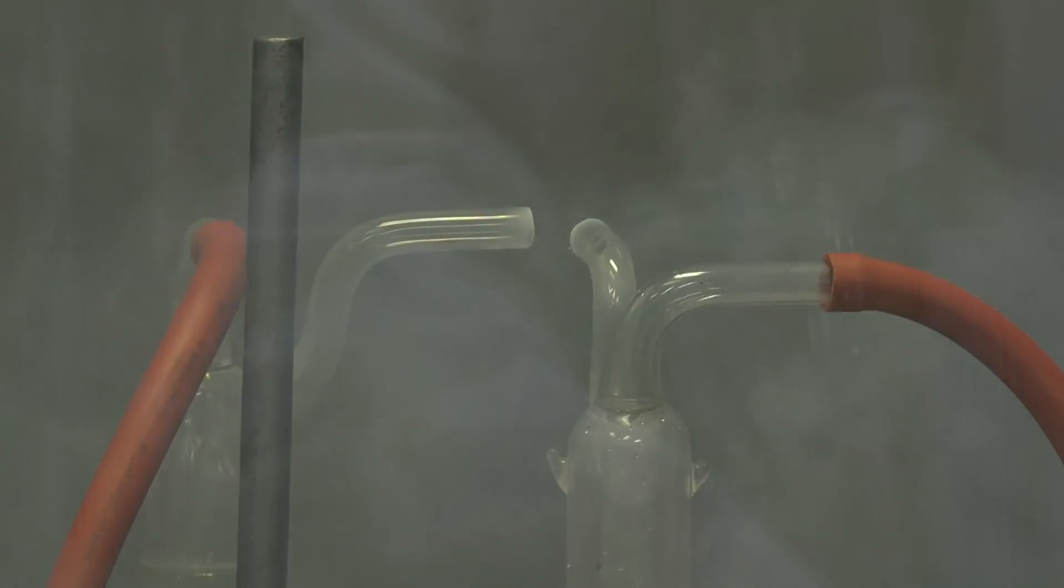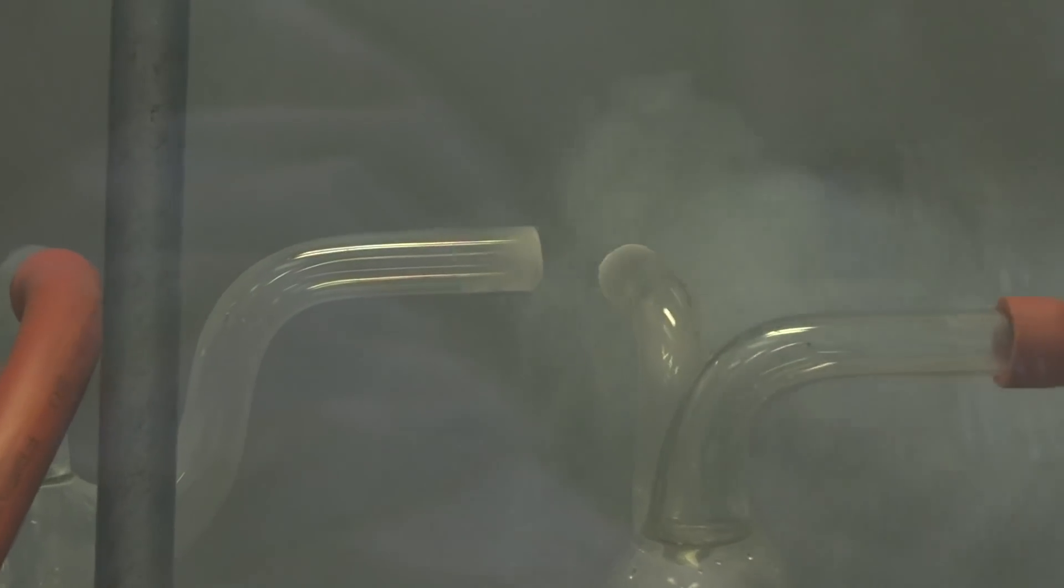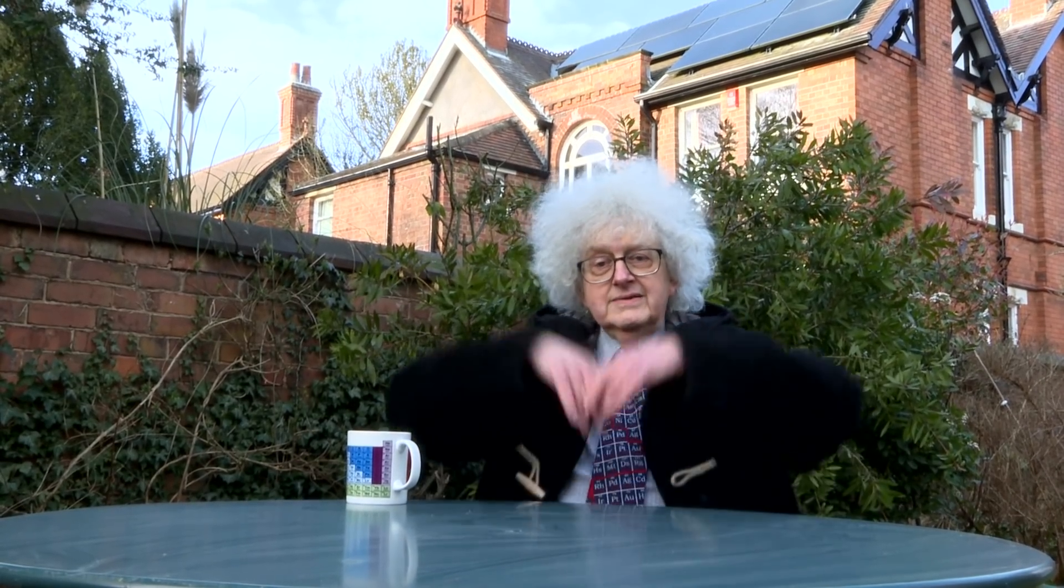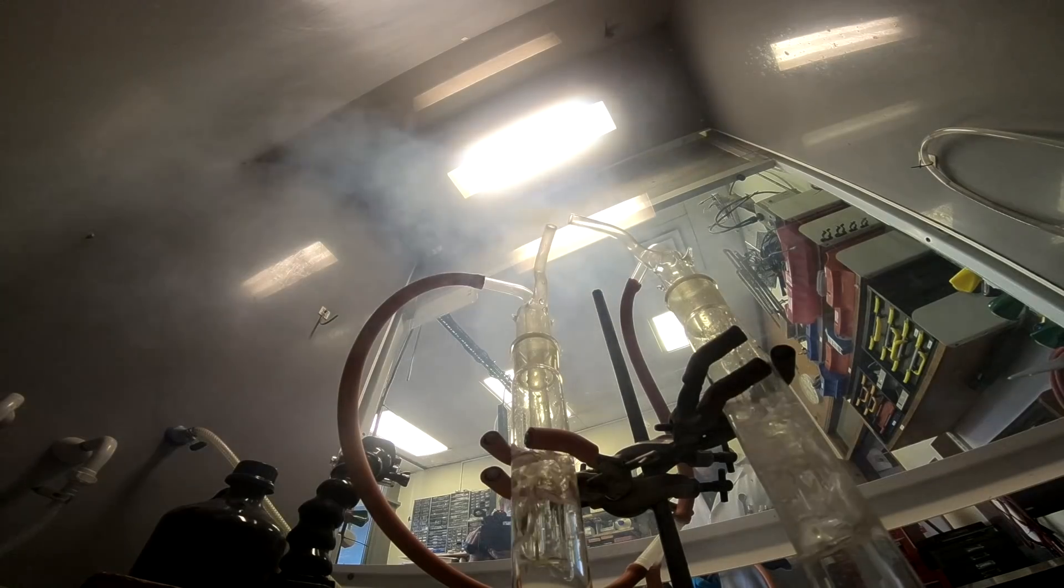And you can see that as these gases mix, they form tiny crystals which are so small that it just looks like white smoke. And these go up into the fume hood.